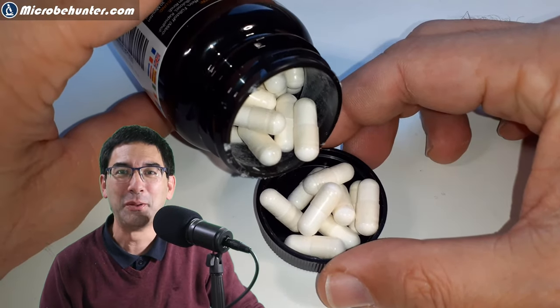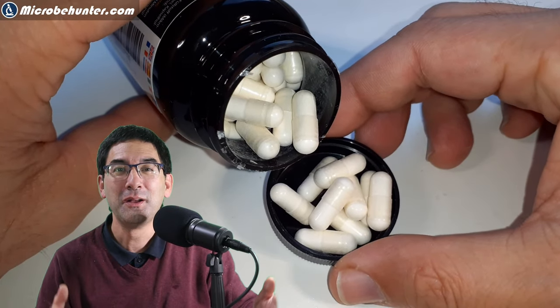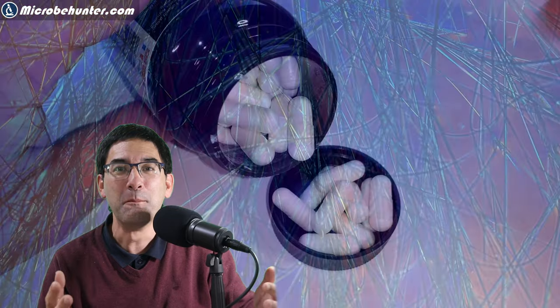Hi, hello and welcome. MicrobeHunter here. These are capsules that contain the most commonly used drug worldwide, and as a matter of fact, this drug is even legal in most countries. It might surprise you a little bit. It's a psychoactive drug. It is caffeine.